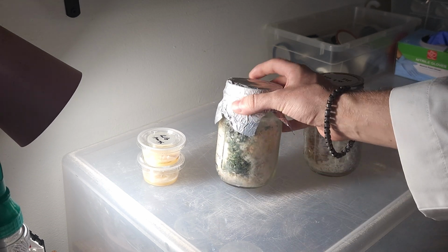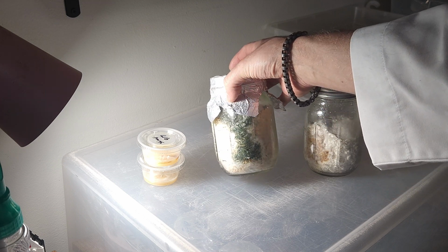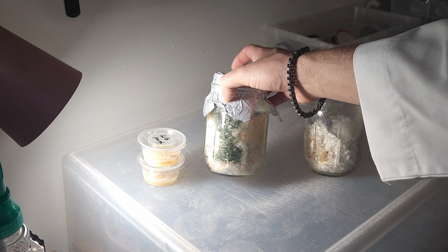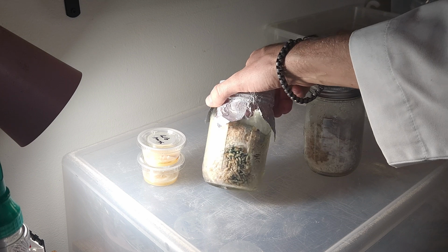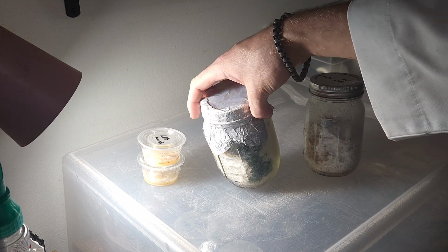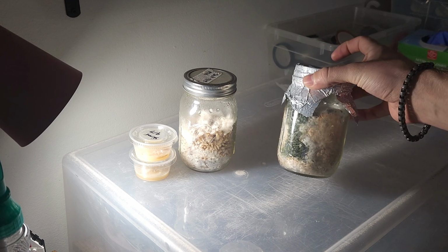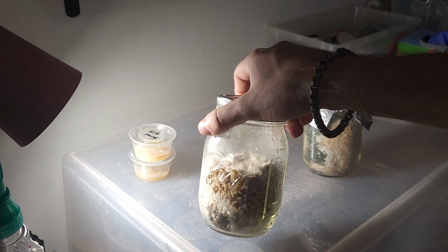Trichoderma contamination happens from spores or mold spores that are in the air that enter into our procedure somewhere along the line. Most likely this happened during the inoculation, transferring agar to grain. It could also be other bacteria that was hidden in the grain or spores that had been moved over. Unfortunately, the only thing to do in these situations is to toss the jar. There's almost always no way to recover from contamination like this.